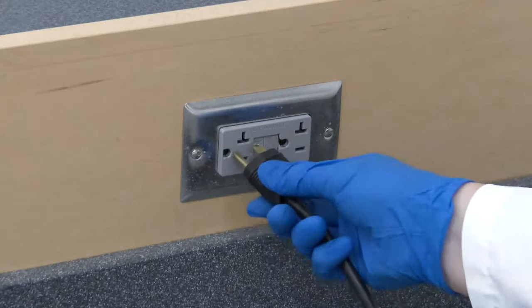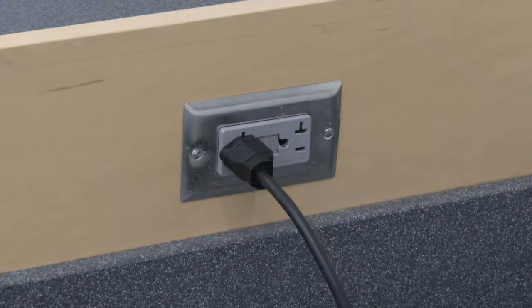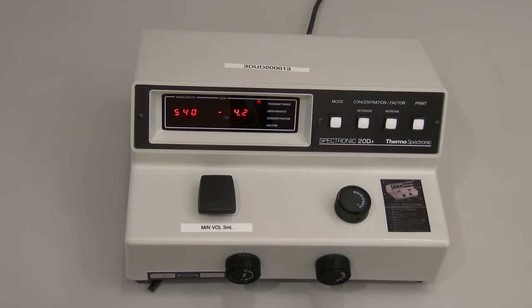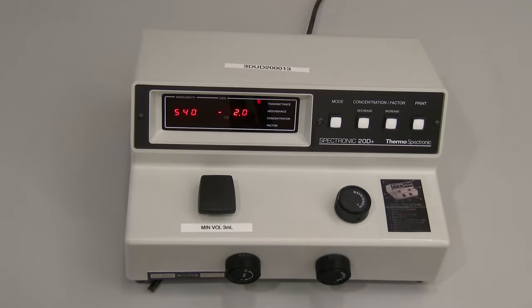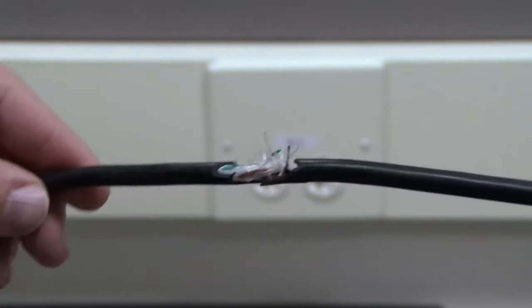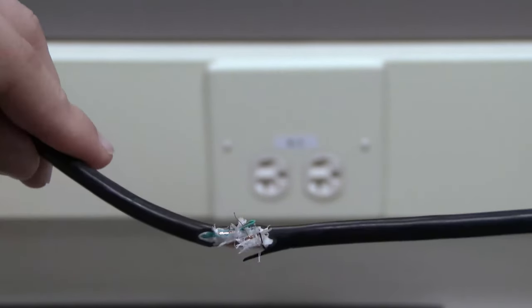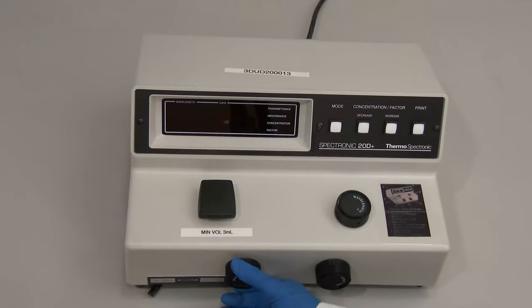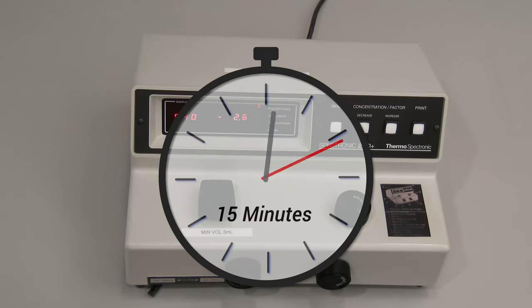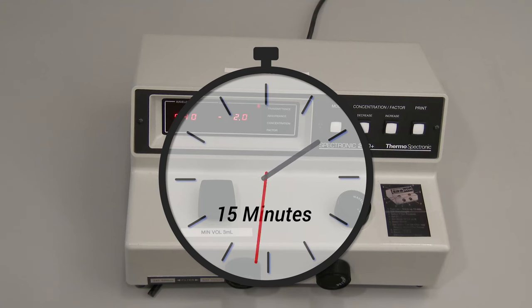To power on the spectrophotometer, plug the power cord into an appropriate outlet and rotate the power switch zero control percentage T knob in a clockwise direction. When working with instruments or equipment, always check the power cords for damage before inserting into a power source. The instrument will click on and the display will light up once the instrument has power.